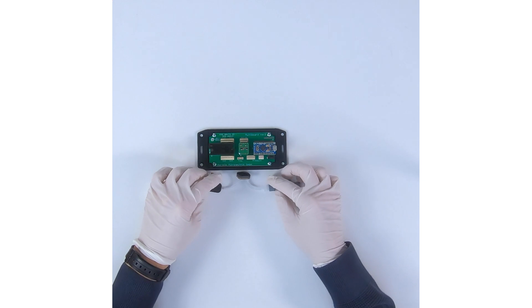So now I connect the MP6 to the MP Damper. As the micropump is a pulsating micropump, we have developed a small flow damper to ease the flow that comes out of the damper, as the read out of the flow sensor might collide with the pulsation of the micropump.